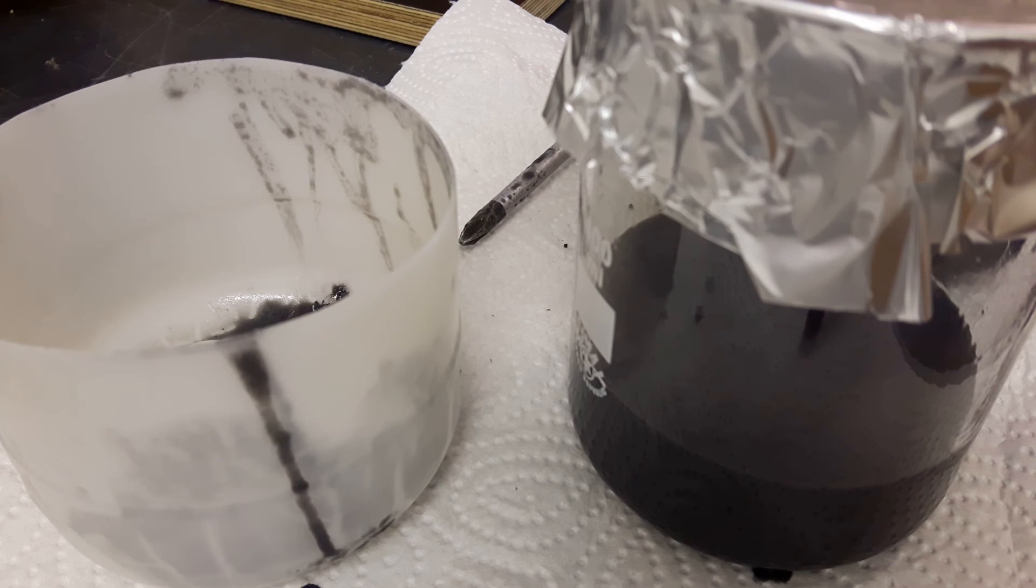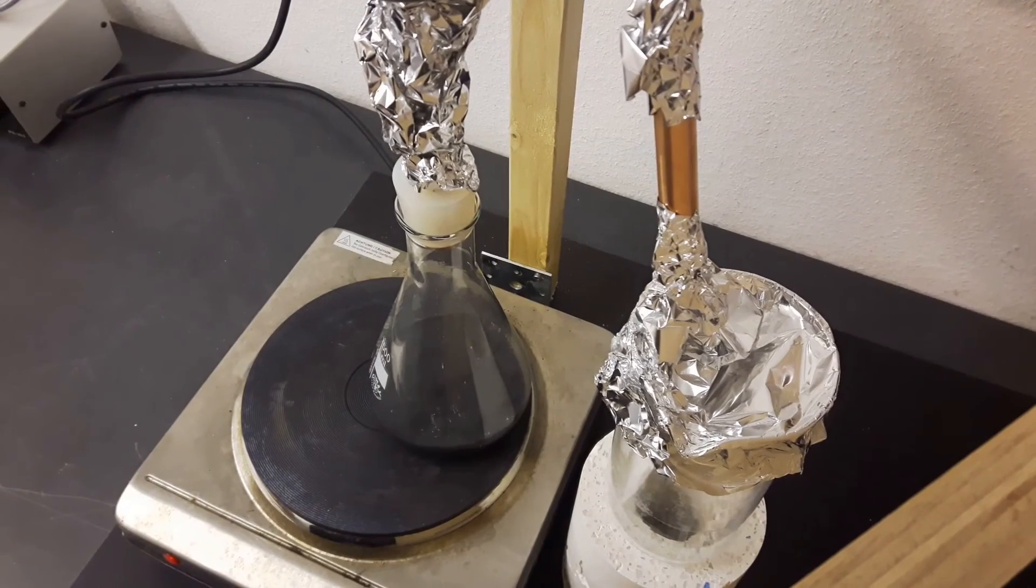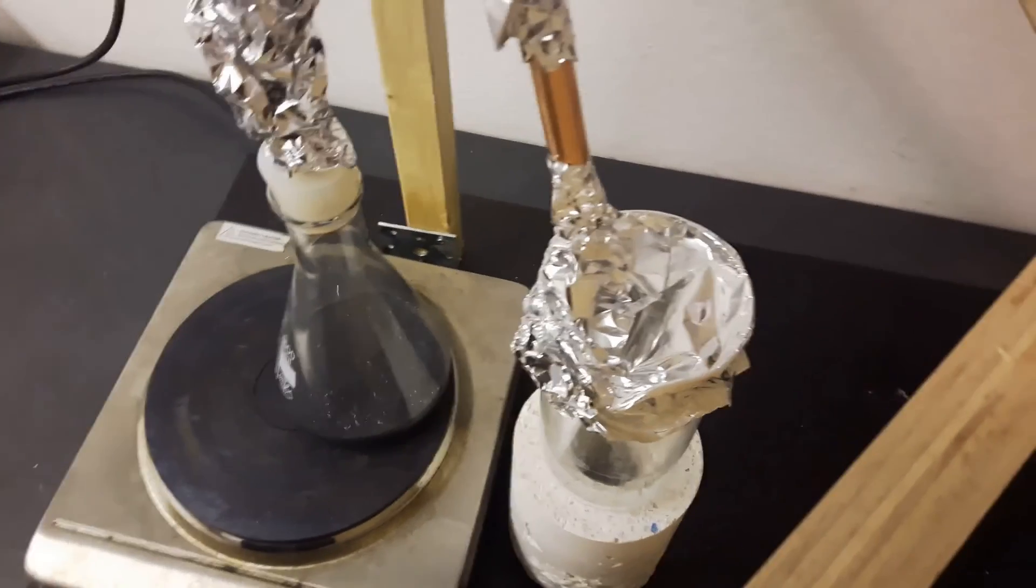To clean these things up I recommend using hydrochloric acid. Because it reacts with the isopropoxide and the aluminum and the aluminum oxide.